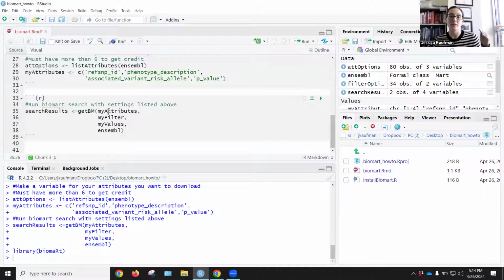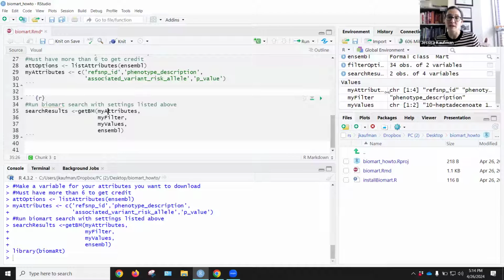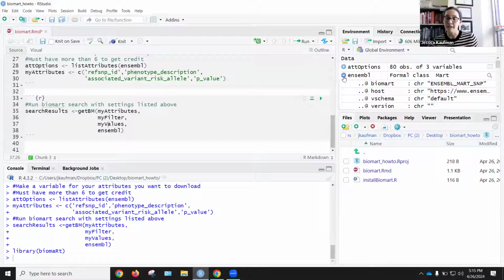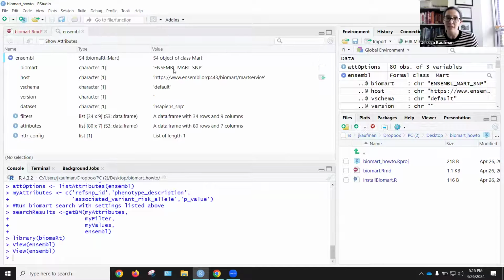Just make sure that you put the variable for attributes and that it's being stored in your environment as a vector. Filter, values, these should all be values and not data. We don't want to put data frames in these first 3 positions in the getBiomart function. And then the last object, ensembl, should not appear in values. It should appear up here in data because it's a special type of data. It's a formal class mart. You can click down to see the information about it, to see which mart you've selected, or you can even double click on it to read it.